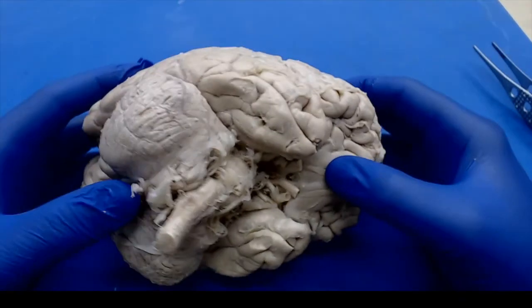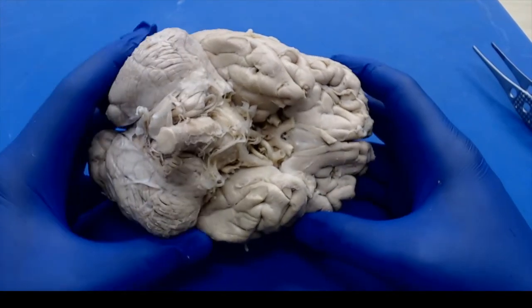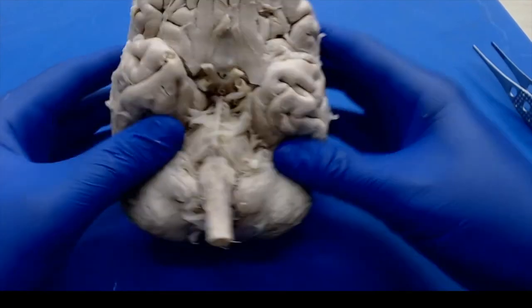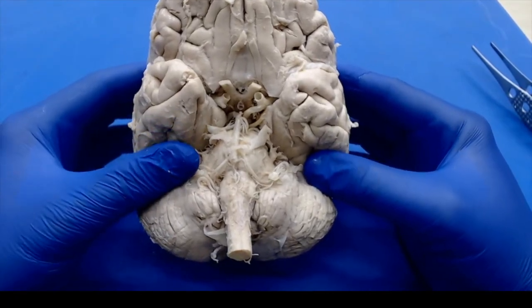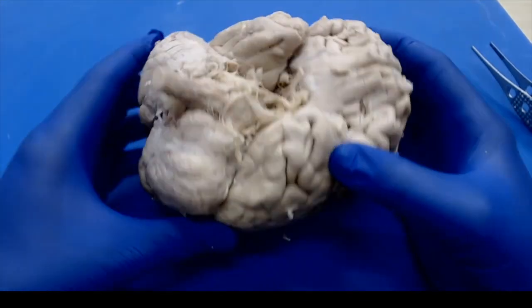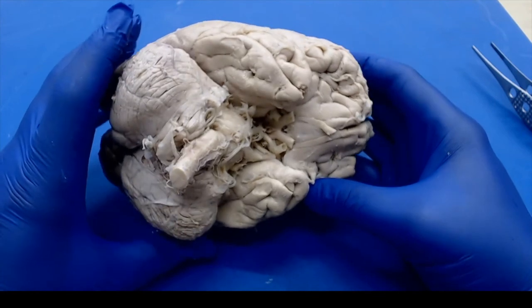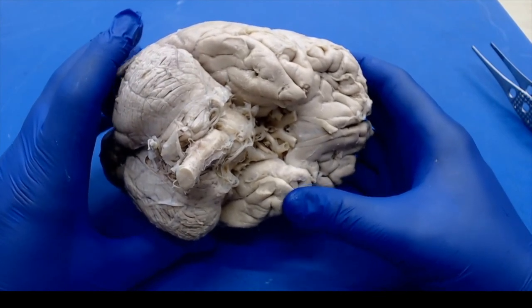Okay, so after looking at some basic anatomy, now we are ready to cut the brain. Now the nice thing is there's not really a wrong way to cut the brain, and other places you go to may have their own unique approach. But there is a way if we're going to look for some basic sections, or if they don't care, if it's just a routine autopsy. There's some sections that we can look for various effects.